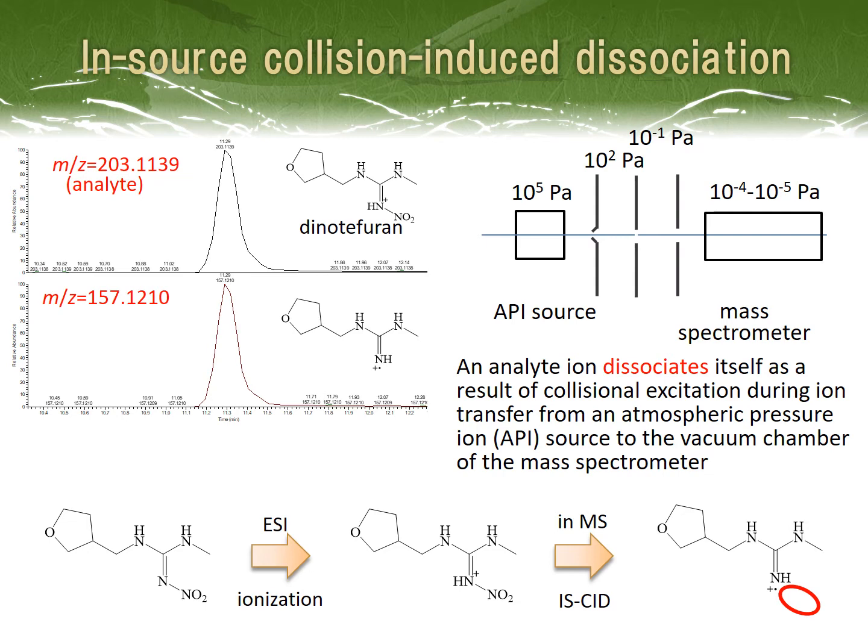These chromatograms were obtained simultaneously. A standard solution of a pesticide, dinotefuran, was injected into an LC-MS. The standard solution contained dinotefuran only. Nevertheless, an unknown ion of m/z 157.1210 was observed as well as dinotefuran. Their retention times and peak shapes were identical. This is because dinotefuran eluted from the LC column was dissociated itself in the mass spectrometer.